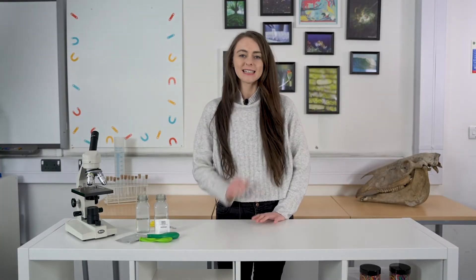Hi, I'm Ali and today we are going to be testing limiting factors on yeast respiration.